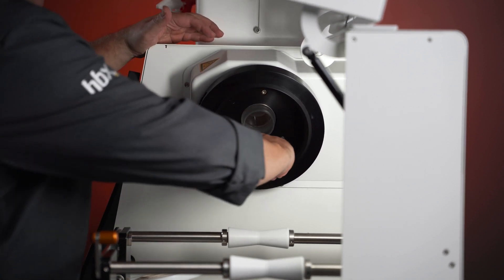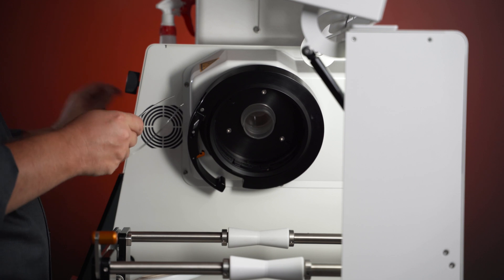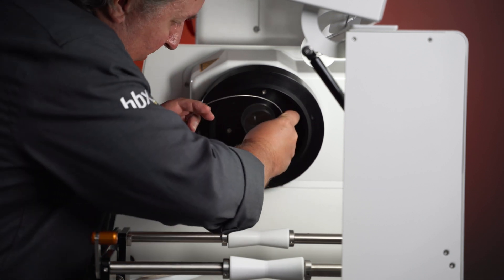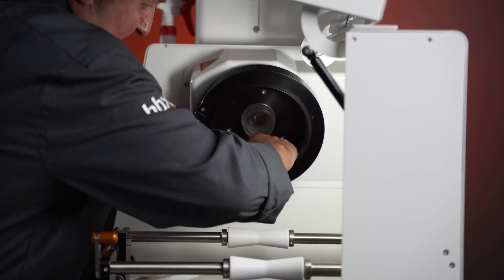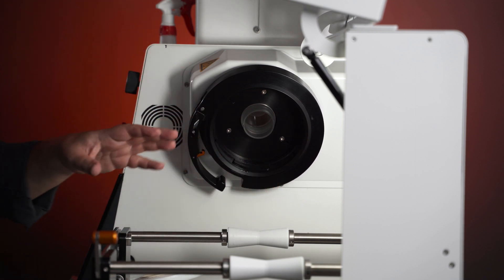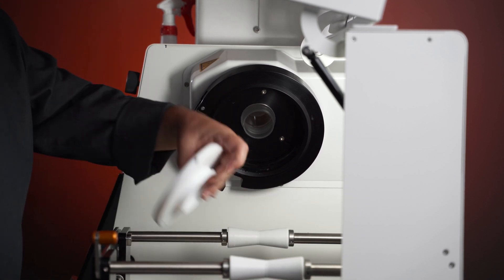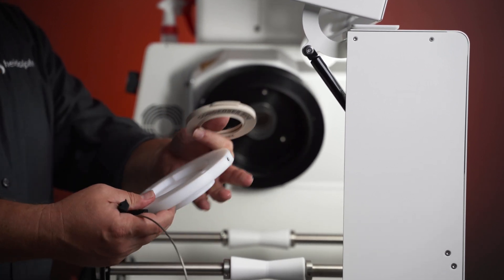To remove the guides and the spring, basically just pull the spring out. You'll start having guides fall out because you do have one up on the top. Sometimes the ones on the bottom can be a little tricky — just take this little bend that's in the spring, put that tip into the hole in the guide, and pull it right out. There's also another component down here which sometimes will come out or won't at all — it has a little spring on it. If it doesn't come out, that's fine; just leave it in because it's much harder to put back. Make sure you give that a good spray with some ethanol. With your springs, guides, adapter, and vapor tube seal all out, just soak these in some solvent for about five minutes and then reassemble the collar.